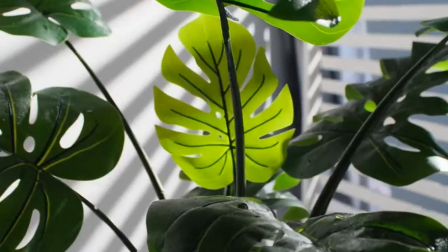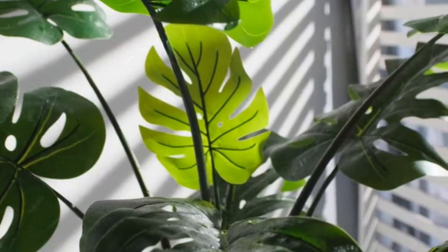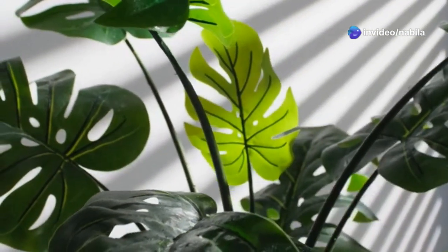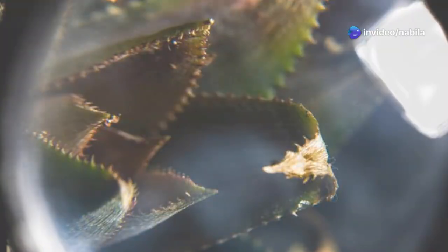Monocot plants, like grasses and lilies, on the other hand, have stomata distributed more evenly on both surfaces of their leaves. This even distribution allows for efficient gas exchange regardless of leaf orientation. This is because their leaves are often held vertically, exposing both sides to sunlight. This vertical orientation ensures that both surfaces can participate in photosynthesis and transpiration effectively.